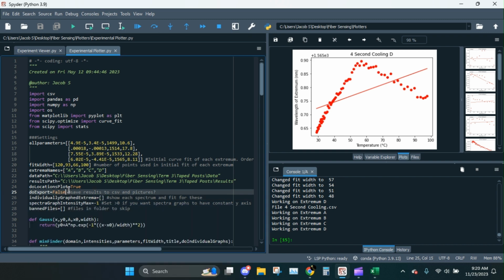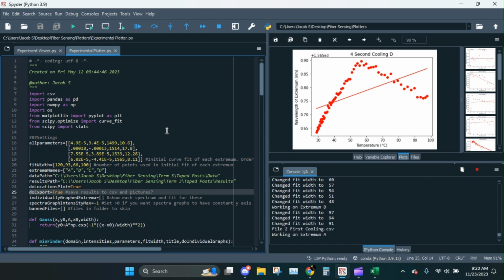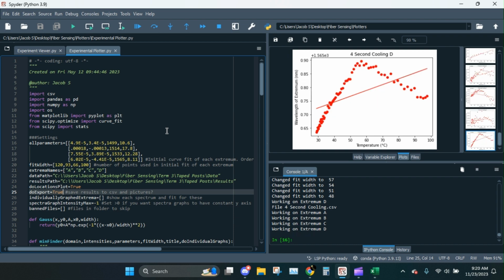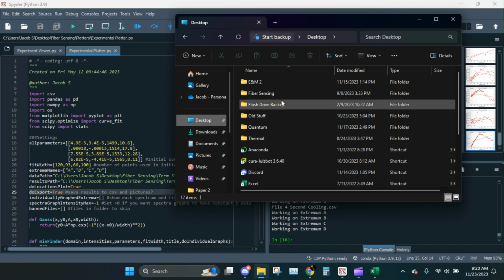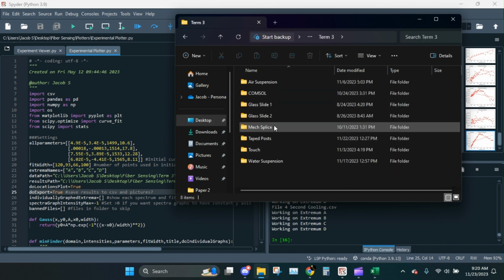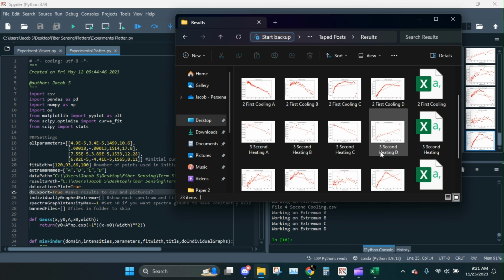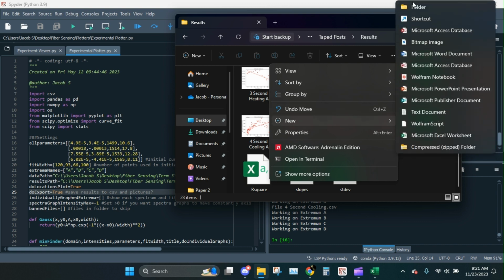So let's go ahead and set do export true. Or if you want to be fancy, you could set it to just 1. And it's going to run again. There we go. So now if we head on over to the folder we assigned as the results path, right there. Boom, look at that. So first of all, we get all of the pictures we generate. I'm just gonna put that into a new folder.